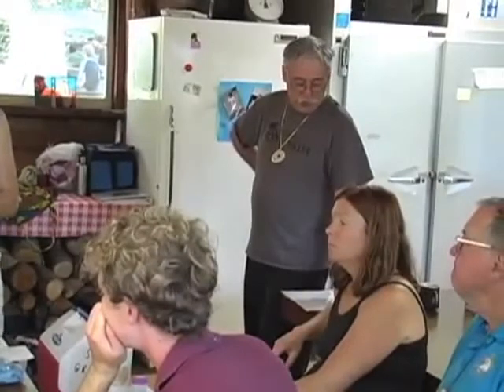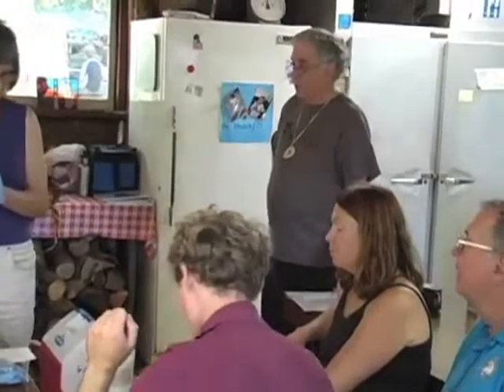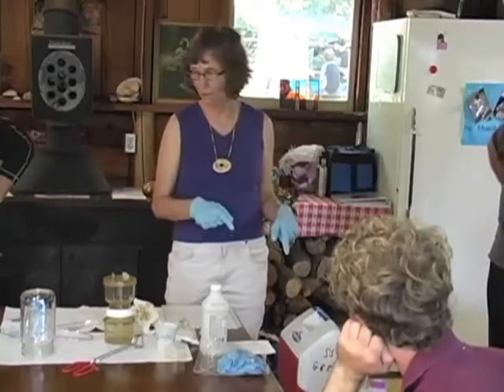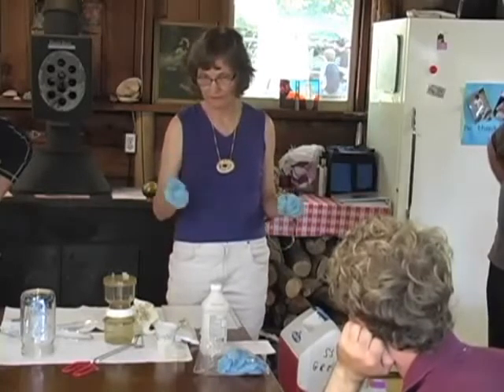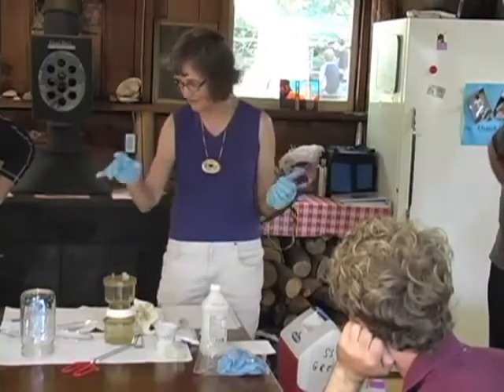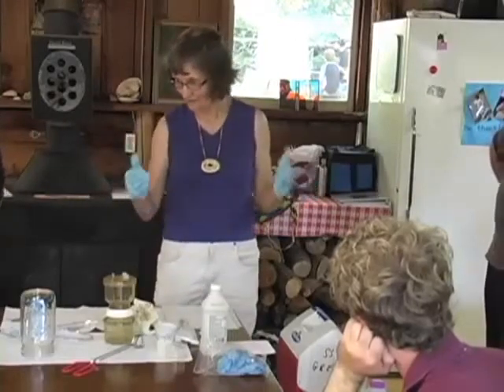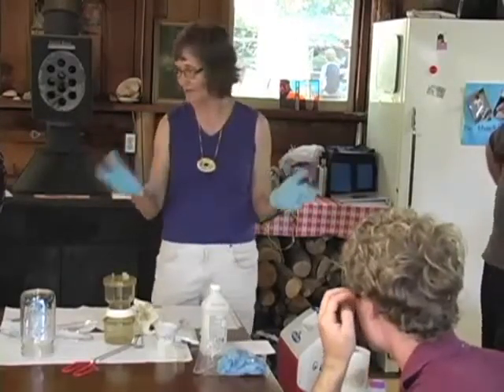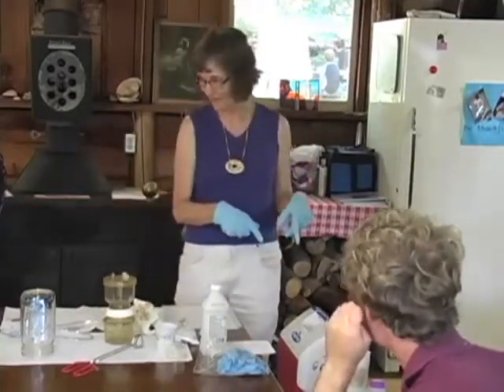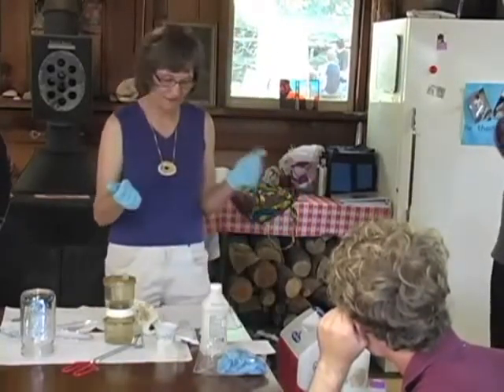One: safely collect a water sample in a sterile bottle beneath the water surface in any existing current. Okay, so we went to 2 places yesterday to get 2 samples. We got one out of Pass Lake. The second one, because we couldn't find a stream around here, he happened to see a ditch with water running. So we grabbed a sample there. Now I did not do my detective work to figure out where that came from. I'm guessing it was somebody watering their lawn too much or something. We can kind of vote, but I'm curious about that water, so that would be my next choice. But if you guys want to do the Pass Lake, we can do that.